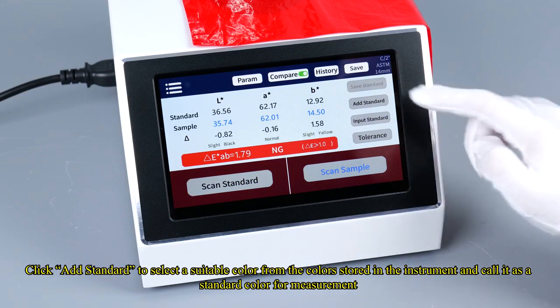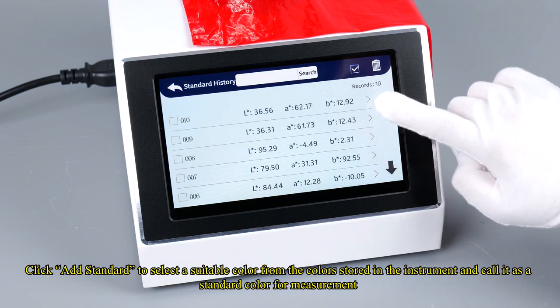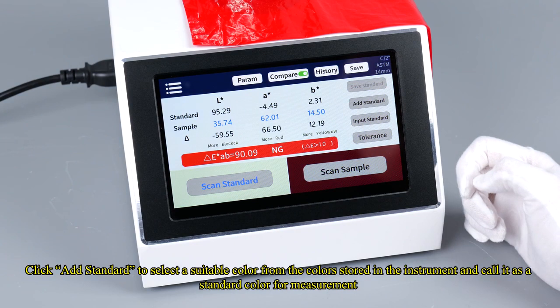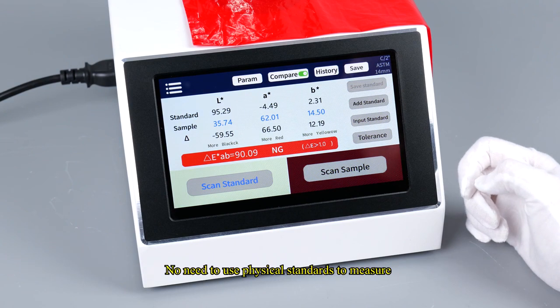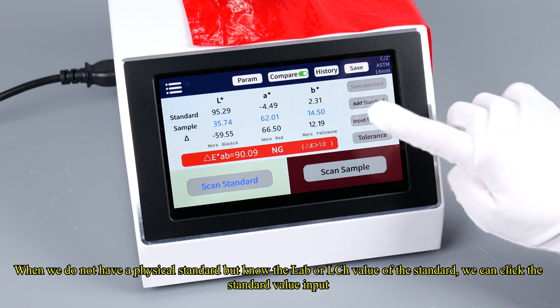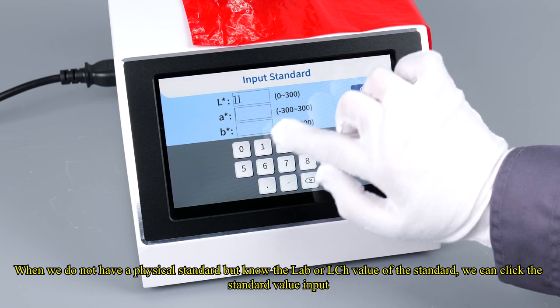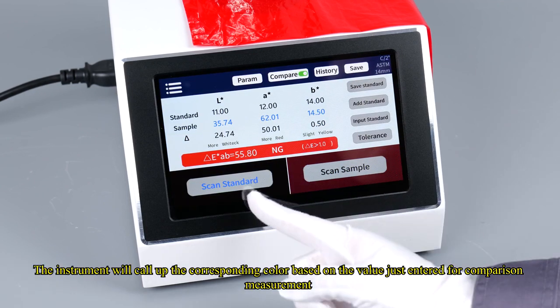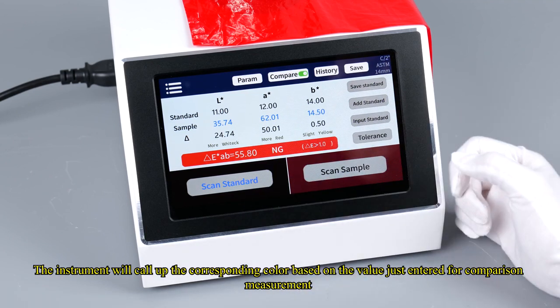Click Add Standard to select a suitable color from the colors stored in the instrument and call it as a standard color for measurement. No need to use physical standards to measure. When we do not have a physical standard but know the Lab or LCH value of the standard, we can click the standard value input. Now enter a set of data for comparison. The instrument will call up the corresponding color based on the value just entered for comparison measurement.